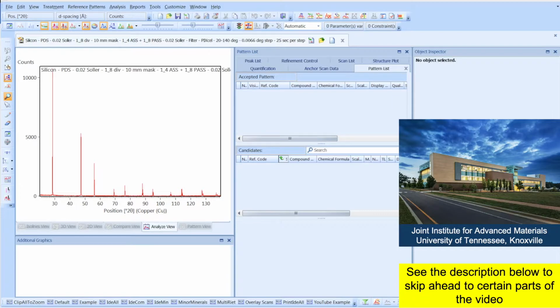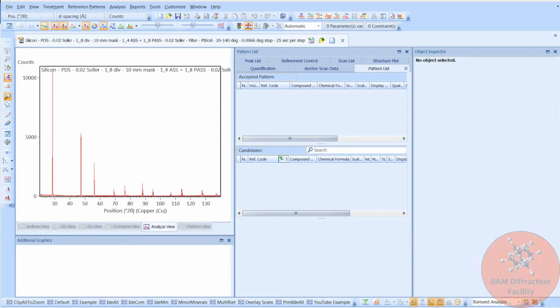I move kind of quickly through some of these steps, so if you have trouble keeping up with what I am doing here, I would recommend that you watch the phase quantification video first and then come back to this one. Now, what we see here is a diffraction pattern for a silicon standard from NIST.